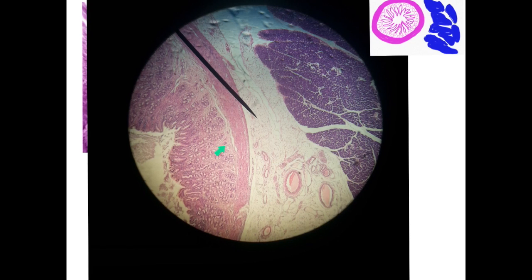The duodenum is a luminal organ that always comes with the pancreas, as it is closely related to it. We have lobules of the pancreas separated by these white spaces due to the dissolving and disruption of the thin, fine connective tissue septa present in the pancreas. And here in the duodenum, you will see the villi and crypts, and the most important is the presence of the Brunner's glands. And this is, of course, the musculosa. So, look for the Brunner's glands and look for the associated pancreas. This is the duodenum and pancreas.